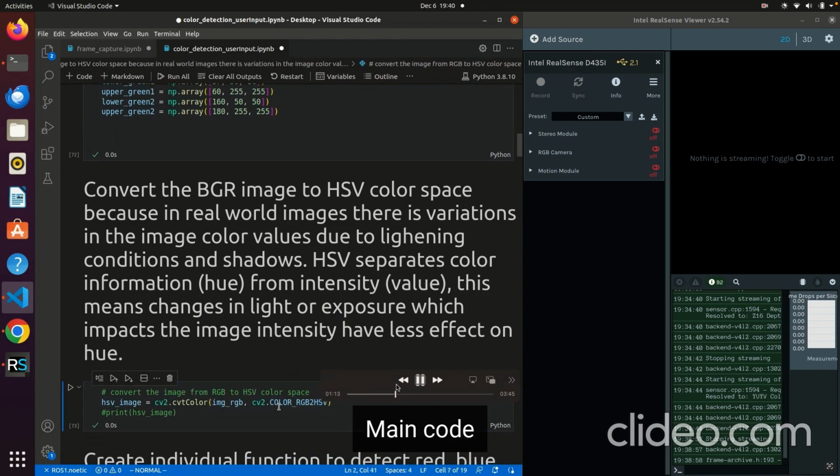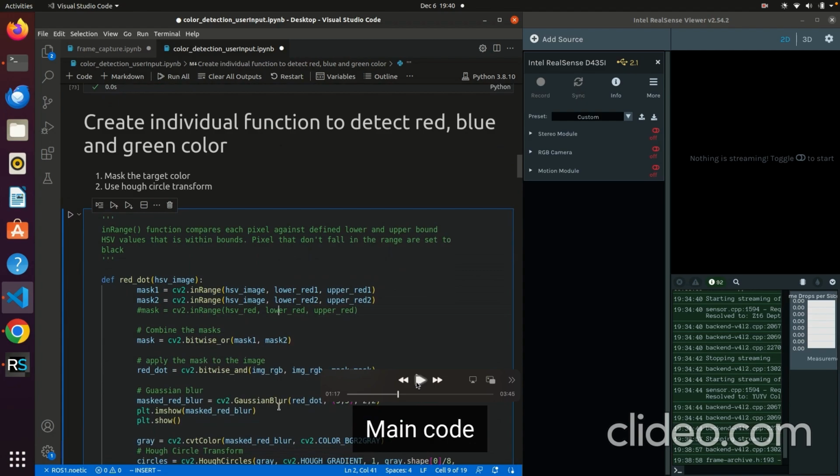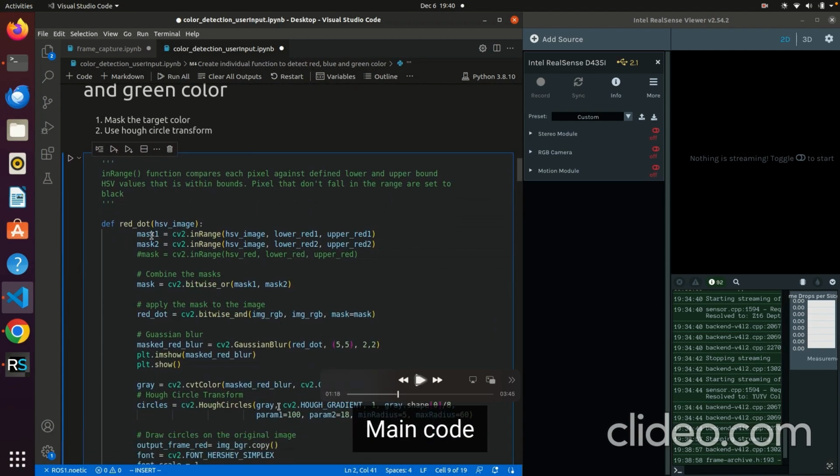And here you convert the RGB to HSV color space, because in RGB you can have a lot of noise, and in HSV color space you don't have much noise or disturbance. Here in this function, I have red dot, where I'm applying two masks. You use CV2 in range on the HSV image with these masks, and it will find the ranges that I've given in the previous line of code. Then you do bitwise on mask 1 and mask 2, meaning that you combine the masks and apply the mask to the image.